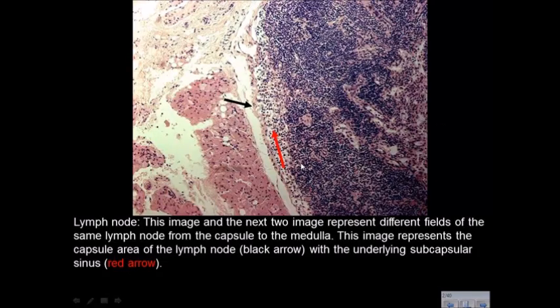Okay, let's look at some microanatomy. Okay, this is a lymph node. And you can tell it's a lymph node because it has somewhat of a subcapsular space. The thin cells just below this capsule thin out, that's the subcapsular space. This is a unique histological slide because you're actually seeing right here an afferent lymph vessel coming in.